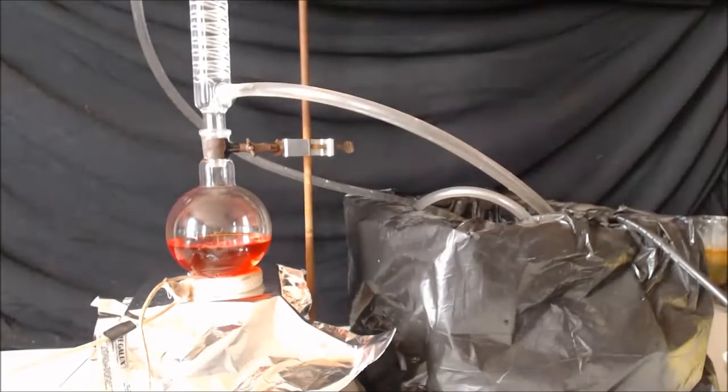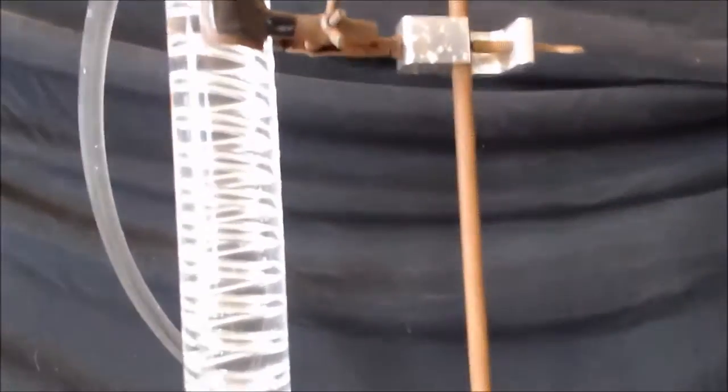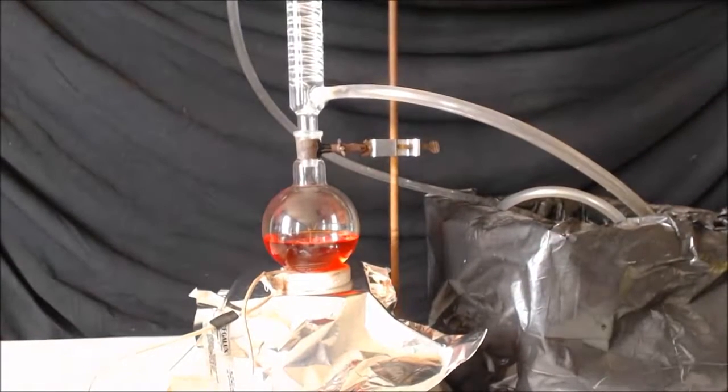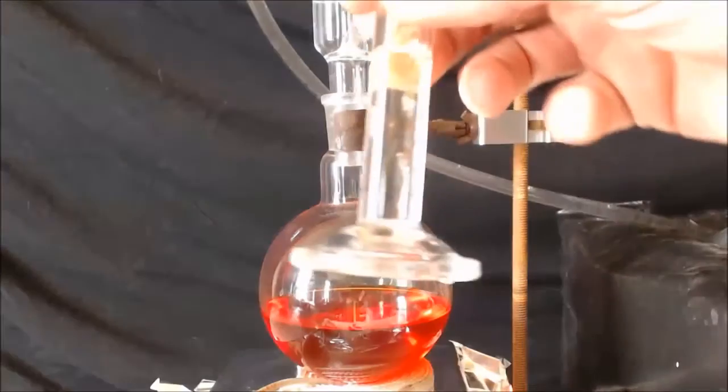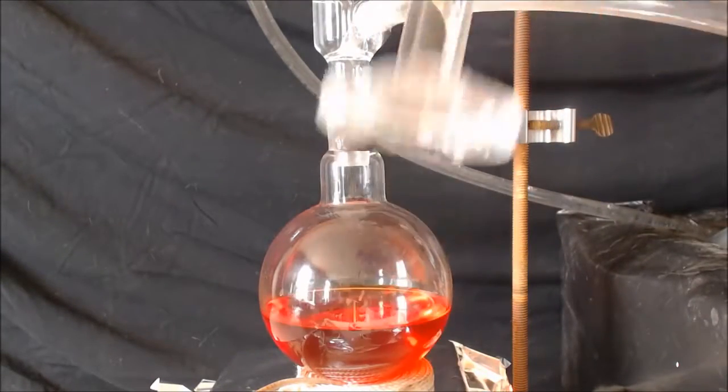I'm going to add my methanol up here on the top and it'll slowly go down there and turn that green because it'll go from a +6 to a +3 oxidation. Now I got exactly 4.8 grams and that's 6.06 milliliters. I have pretty much exactly everything here. I've never been more precise. There it goes, I'm going to toss some in right now, just a little.